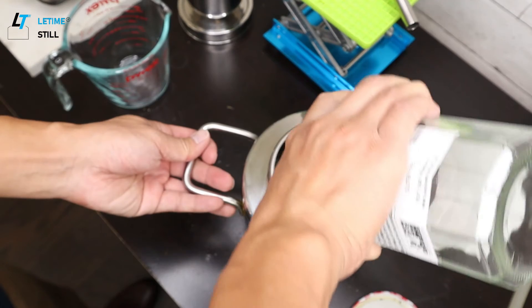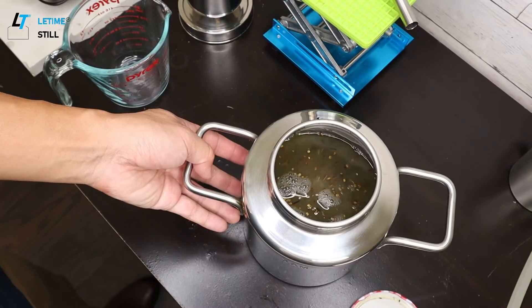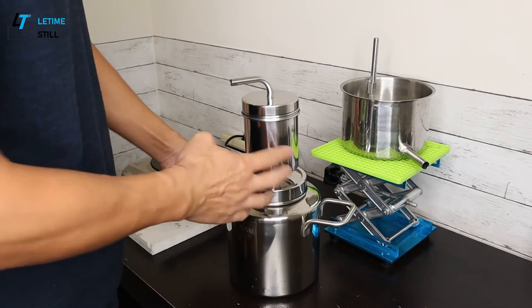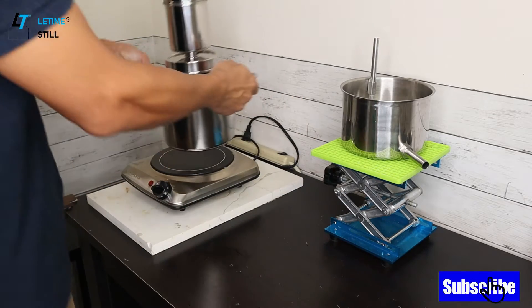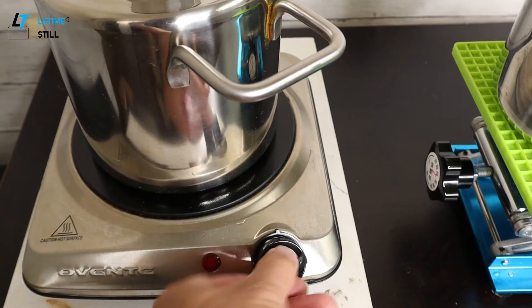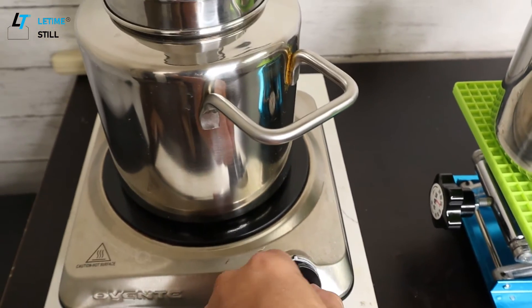The difference between separating alcohol and making a hydrosol by hydro distillation is that the alcohol will come out first because of its lower boiling point and ease of vaporization. So we collect the distillate, which is the alcohol.